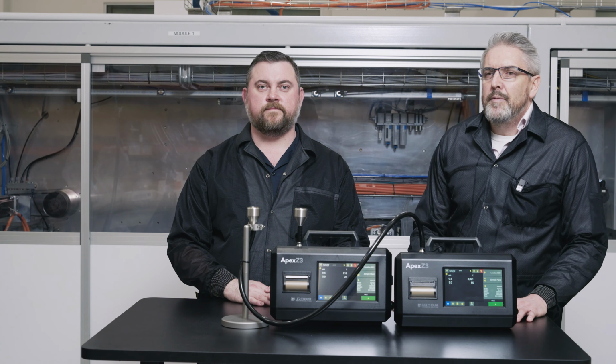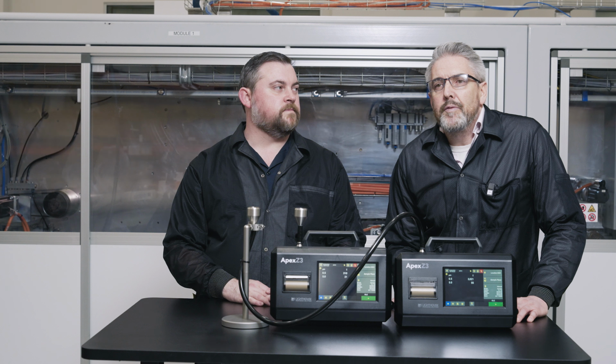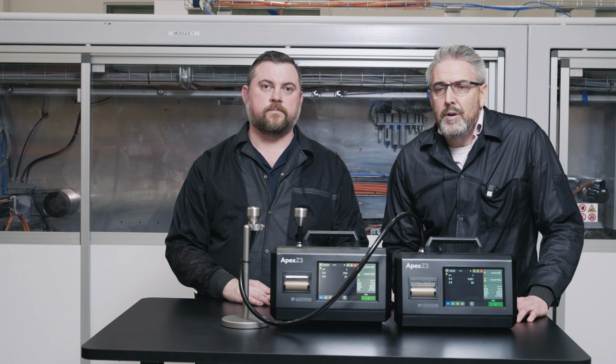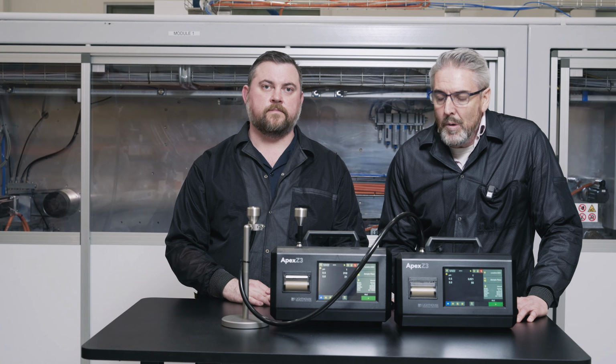Well, that about wraps it up for our testing and the validation of the particle losses in the sampling setup according to ISO TR 14644 Part 21.